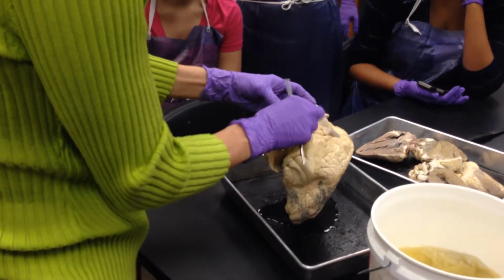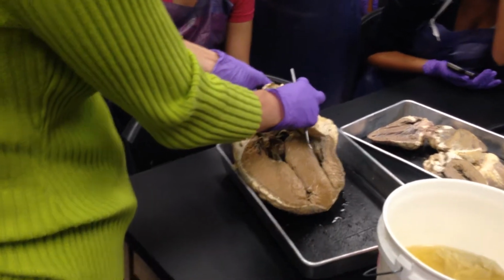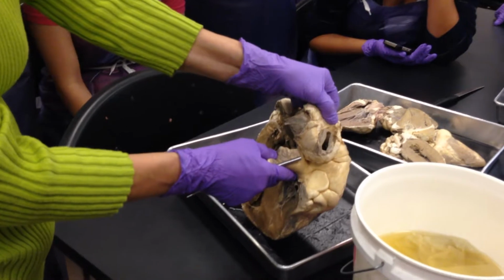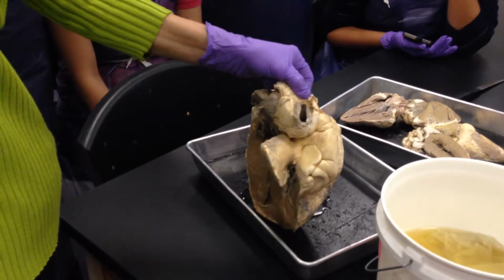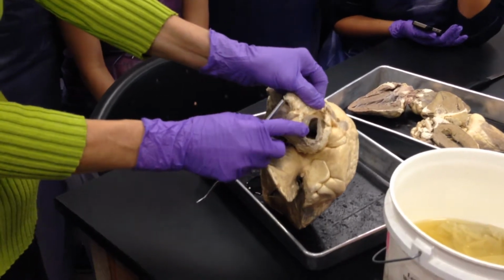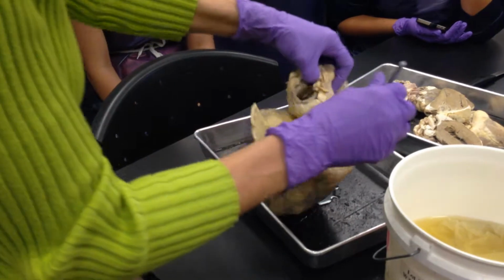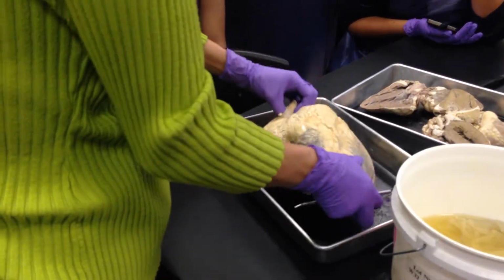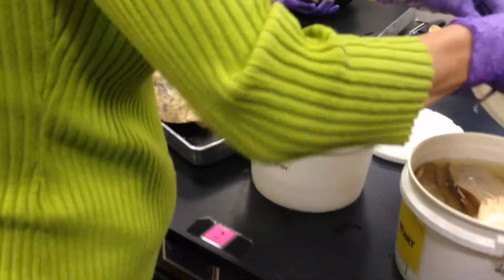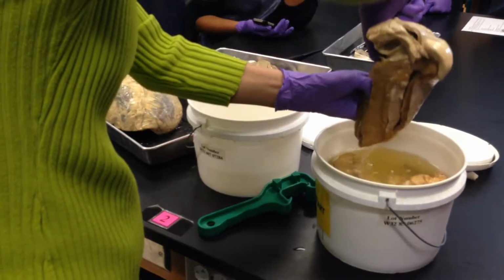And then this huge, look how thick. Remember the three walls of arteries? What are the three layers from our module? Tunica intima, tunica media, and tunica externa. Look how thick that tunica media is on this one. Just huge, the largest blood vessel in our body. So that's that cow. This buffalo heart is also really nice because it shows some other structures, those semilunar valves, a little bit better from a different angle.